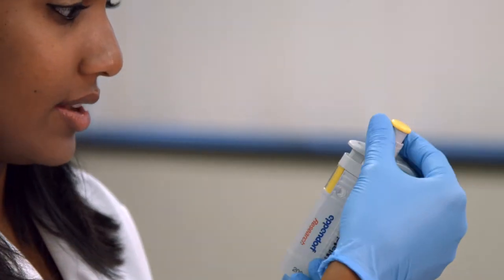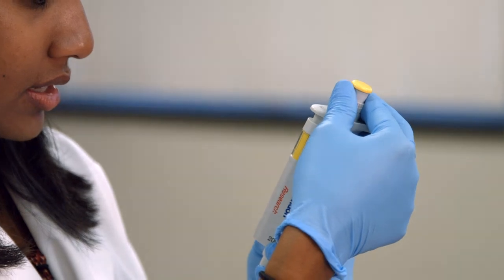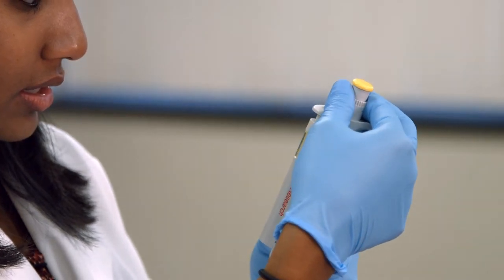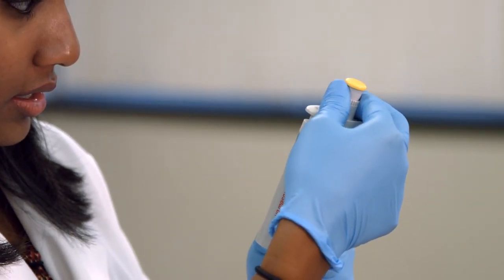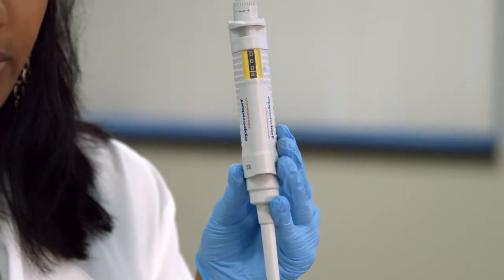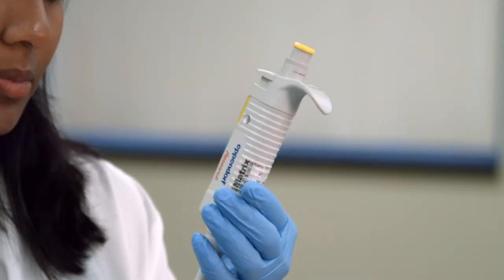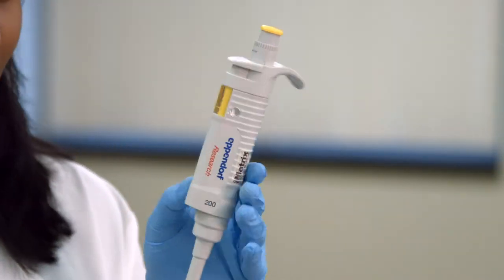This is 80, and now this is 80.4 on here. I guess this goes up by increments of two, but some of them do go by increments of one, so that's why I couldn't show 80.5.